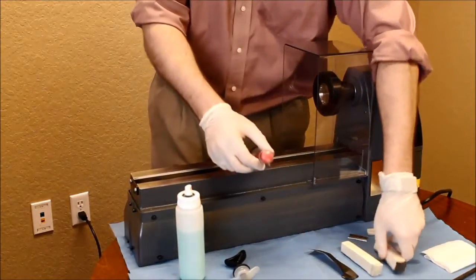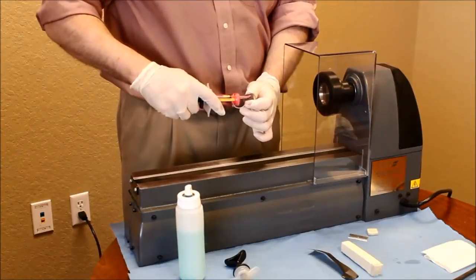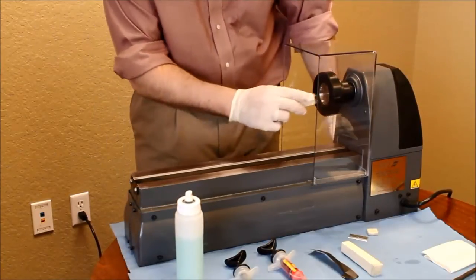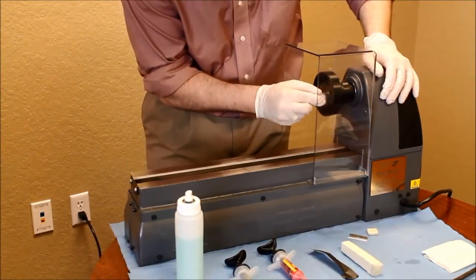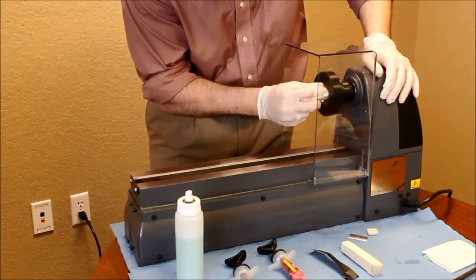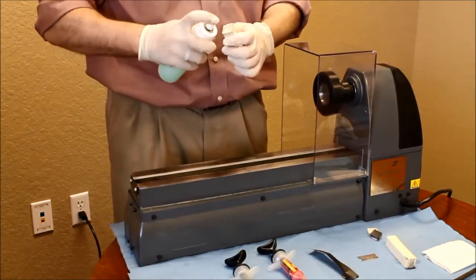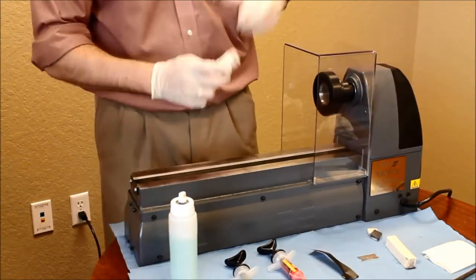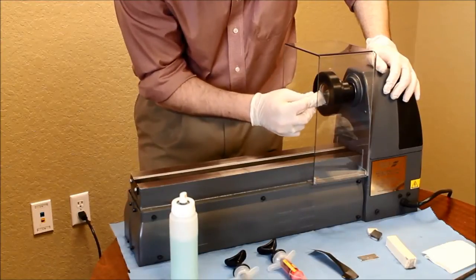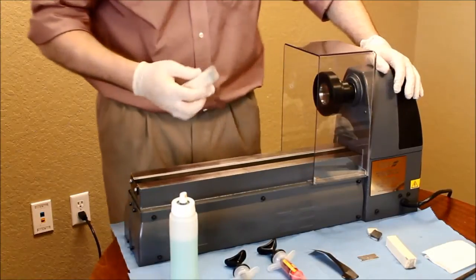Apply the 8 micron diamond compound to a hard grinding stick, coating with oil, and if necessary, stopping the lathe to apply. Ensure to grind from the center outwards, keeping even pressure applied, and once complete, remove the polishing compound with a soft cleaning stick. If necessary, repeat the process of applying more diamond compound until a mirror image can be seen.